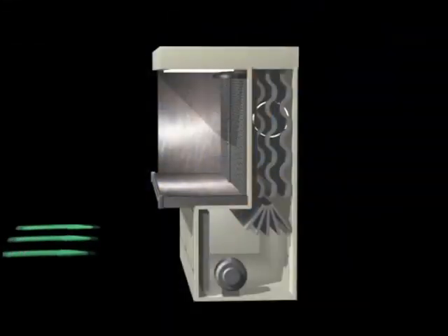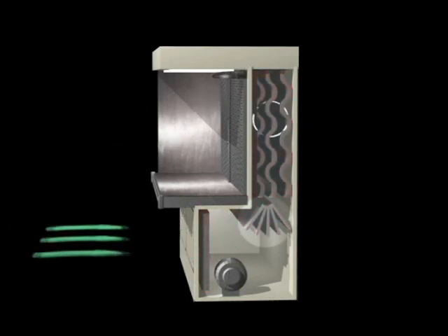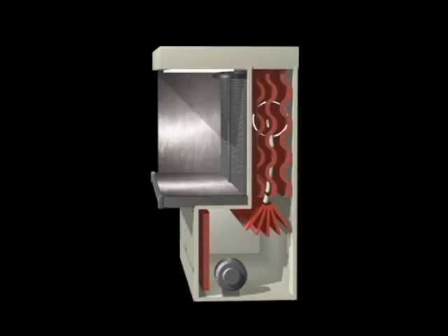The most important part of a laminar airflow workbench is a high-efficiency bacteria-retentive filter. First, room air is drawn into the unit and passed through a pre-filter to remove gross contaminants, such as lint and dust. Next, the air is blown through the plenum of the hood and the HEPA filter, and finally over the immediate aseptic compounding area. This twice-filtered laminar layer of aseptic air continuously sweeps the work area inside the hood to prevent the entry of contaminated room air. Let's look at the two most common types of laminar airflow workbenches: horizontal airflow and vertical airflow.